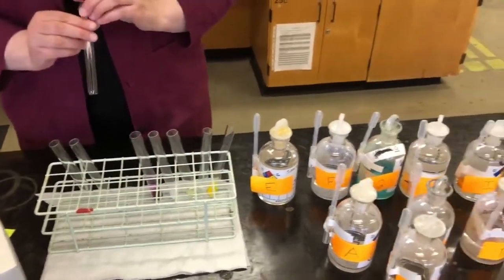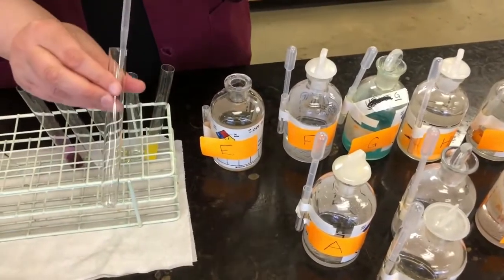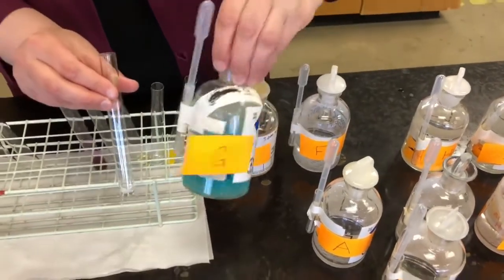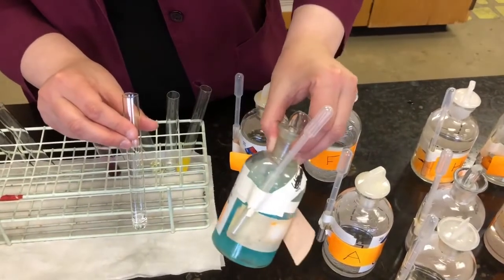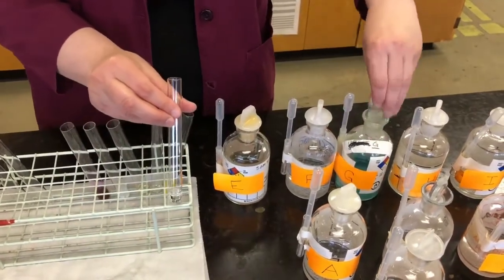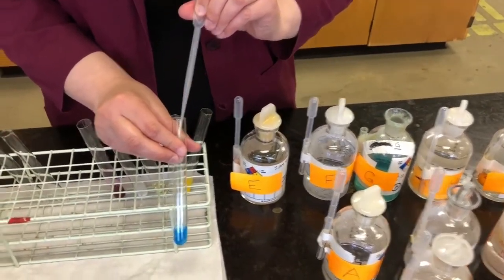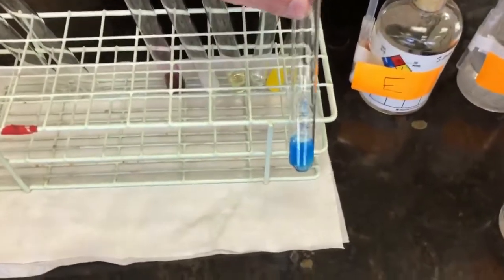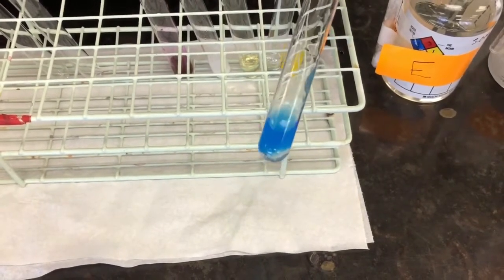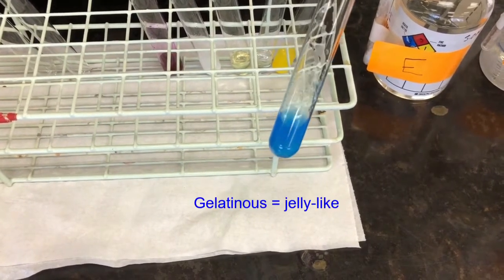Next test is going to be E and G. So E, again, clear colorless. And this time it's E plus G. And you can see if you look at G, that it's a little hard to see, but it's a light blue solution. So take 1 milliliter of G. Now it's still blue, but you can clearly see that it's a different color blue. So that does indicate a chemical reaction. You can also see, if you look closely, that it formed another jelly-like type solution. So it's a gelatinous precipitate.